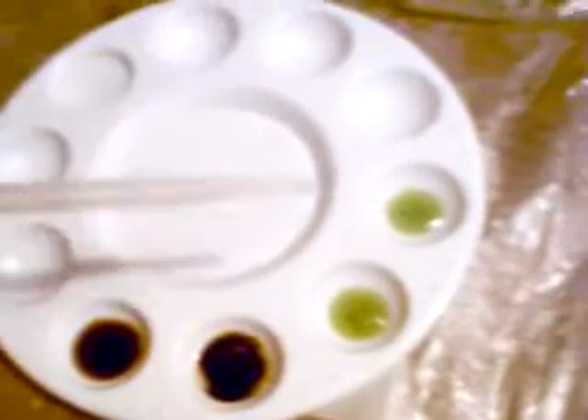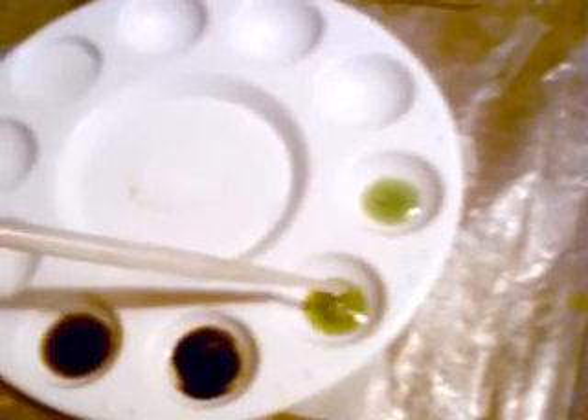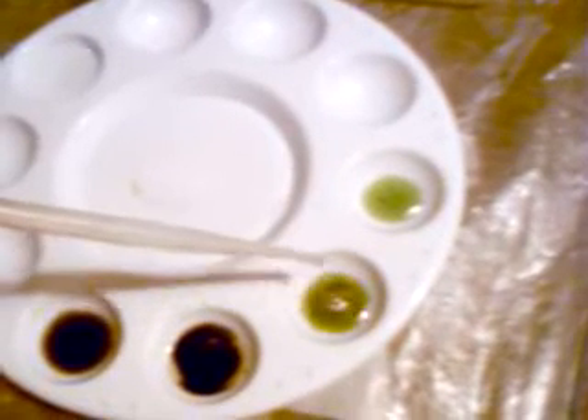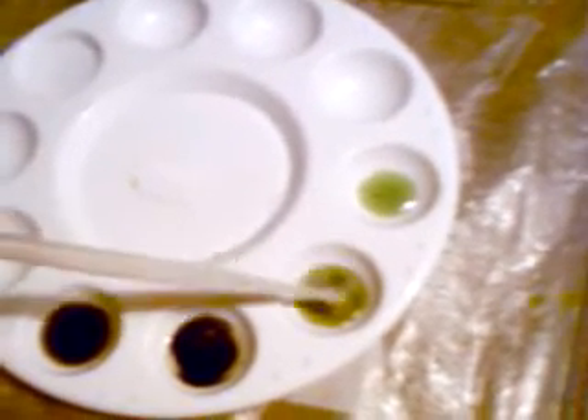Back to the dish at hand. I'll try it again right here on cam so you can see the reaction. This is with stannous chloride. The stannous is getting a little bit weak — let it sit a little too long while I was doing some other tests. But it still showed the brown reaction, brown-black, indicating that it's a gold-palladium mix. Potassium iodide is the interesting one.